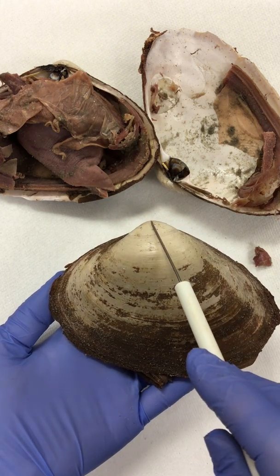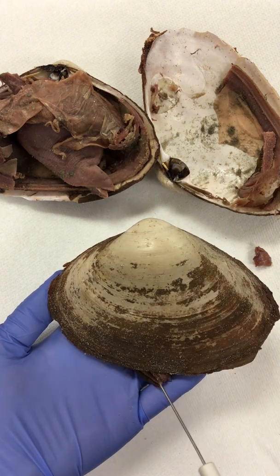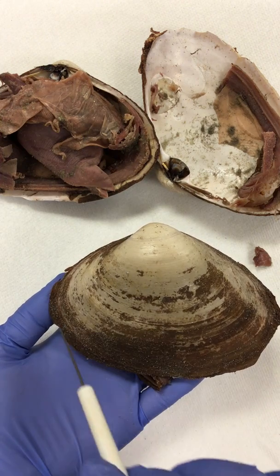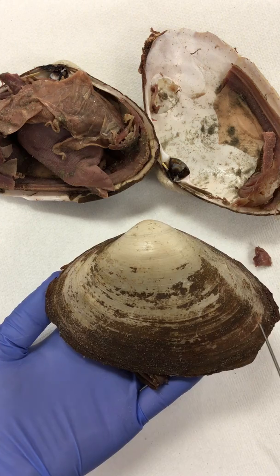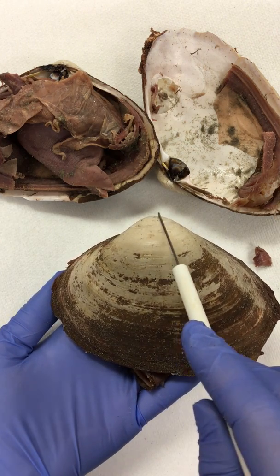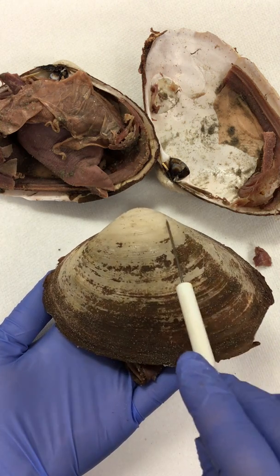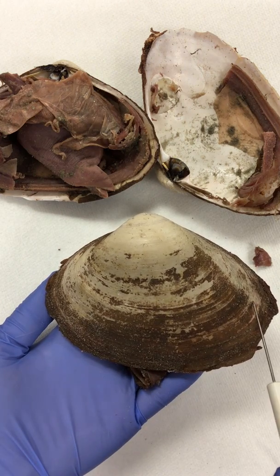So the dorsal closes the clam right there. You can see this would be the dorsal region. The ventral is going to be to open it. The anterior side is the shorter, or smaller, side, and the posterior is the larger side. So if I'm looking at the clam itself, I'm going to notice that the distance between the umbo, which is this distinguishing hump, to the edge of the clam is shorter on this side than it is on this side. So that tells me this is anterior and this is posterior.